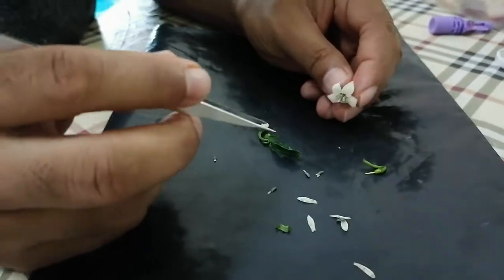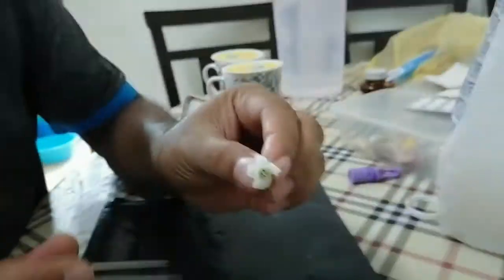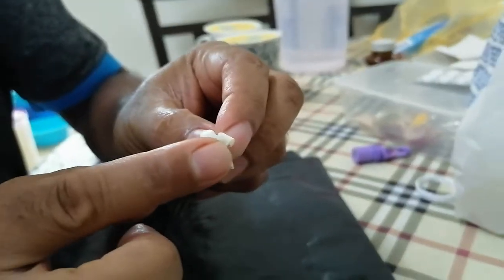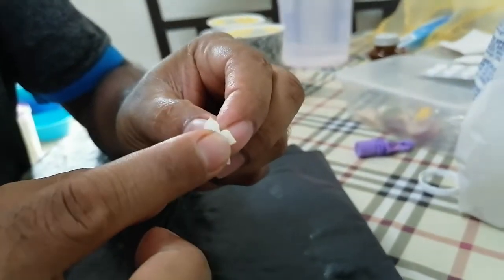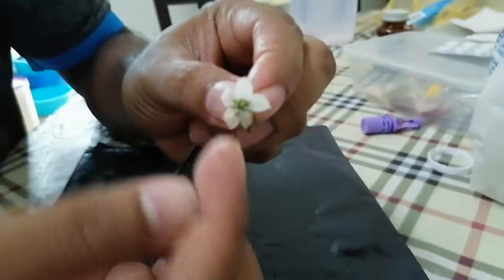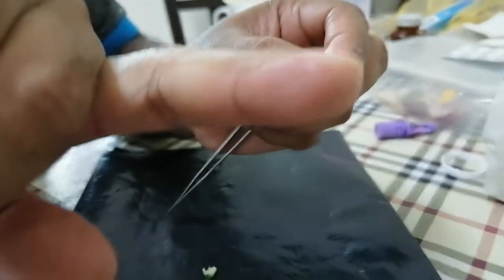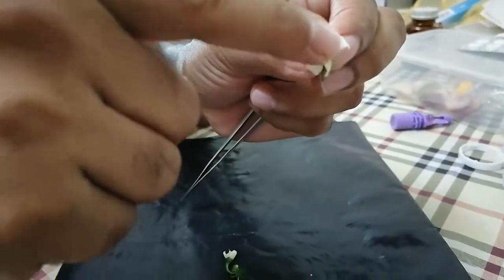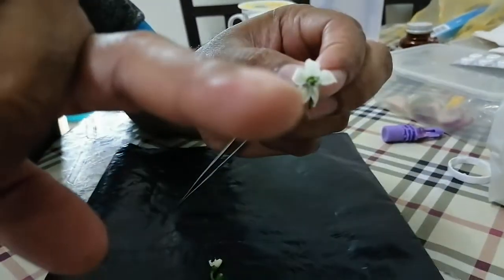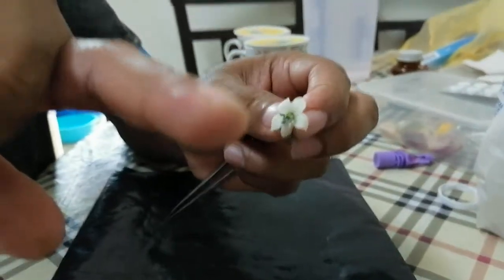This is open, and here I want to show you some powder — this is called pollen. It's very difficult to show, but you can see the whitish color here from the anthers. This whitish color is the pollen from the anther.